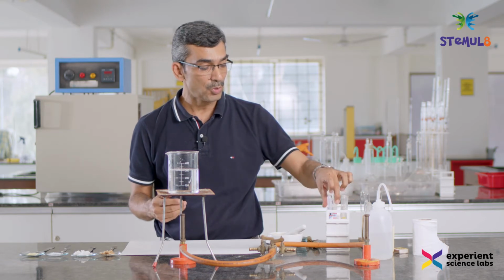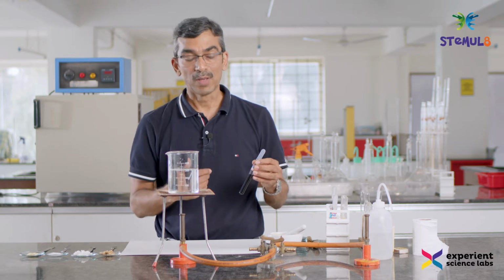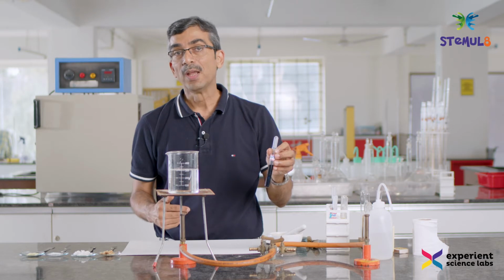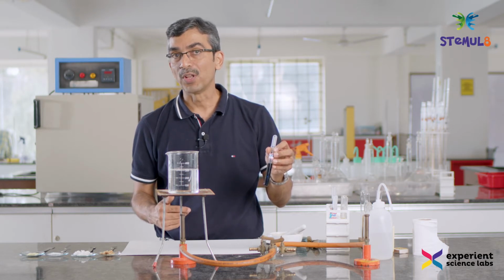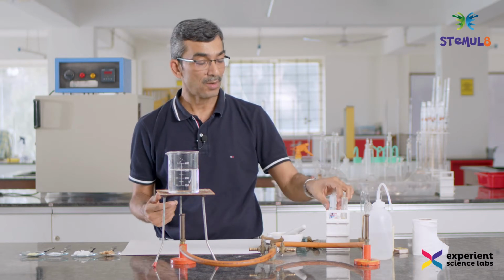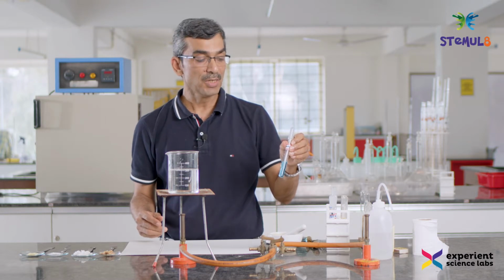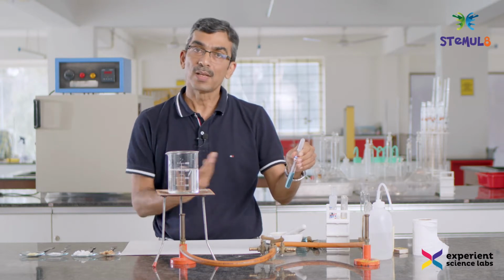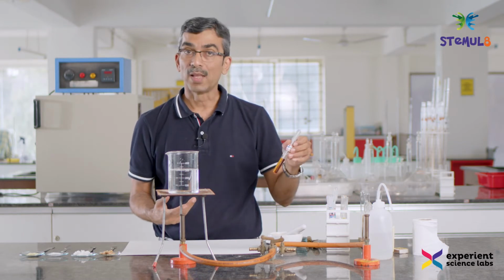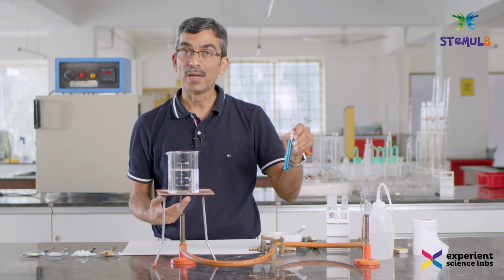What are the reagents that we use to identify these major sources of food? So the first one is DCPIP. It is dichlorophenol indophenol. It is dark blue in color, and we will see how it reacts when vitamin C is present. This is a biuret reagent. It is light blue and it has copper sulfate as a major component in it. Then iodine, and also the Benedict reagent.